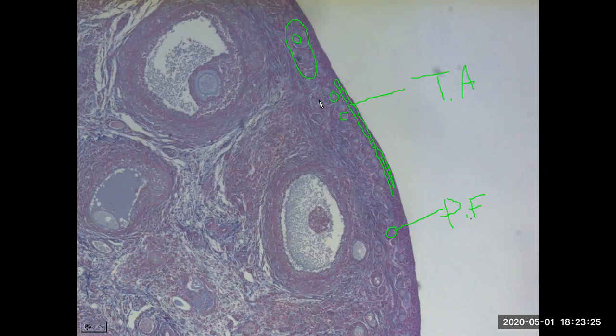Whereas skipping over, these primordial follicles do develop with the ovarian cycle and over time. Now here's an example, skipping many steps over to a tertiary or mature or Graafian follicle. Multiple names for the same thing here. And within the mature follicle especially, we could get a good look at the oocyte. So that egg that's still undergoing some maturation process. The entire structure is the mature follicle, and within we see the oocyte.